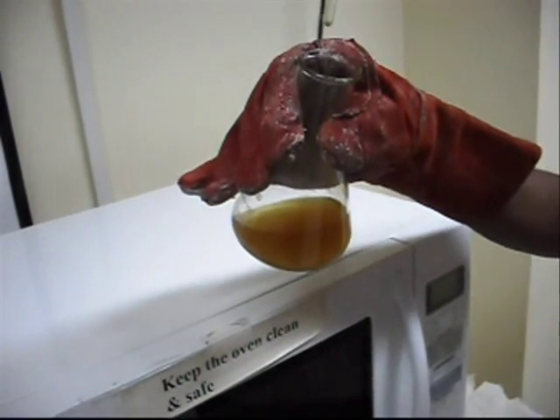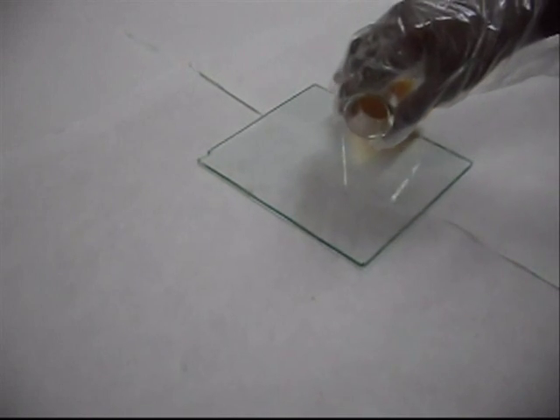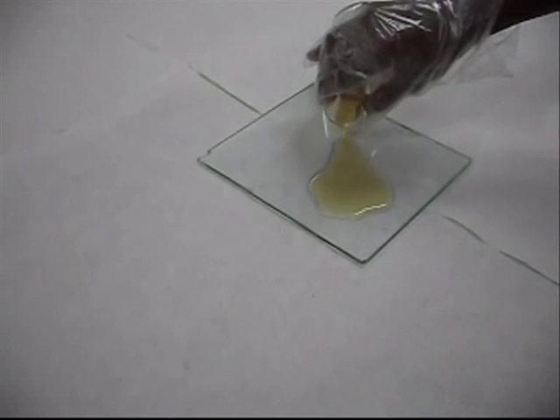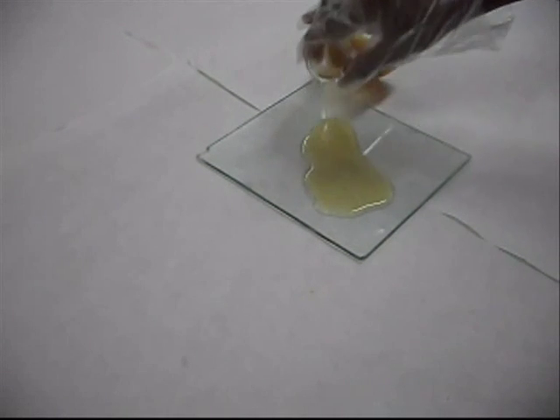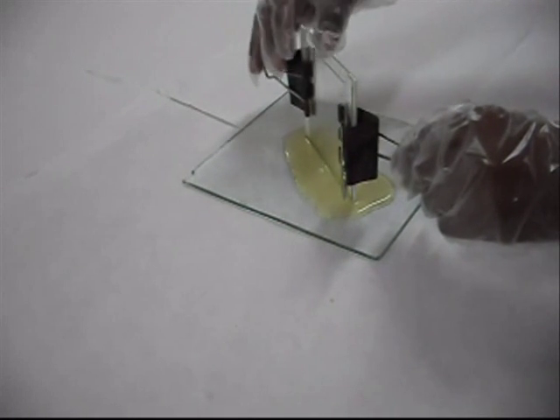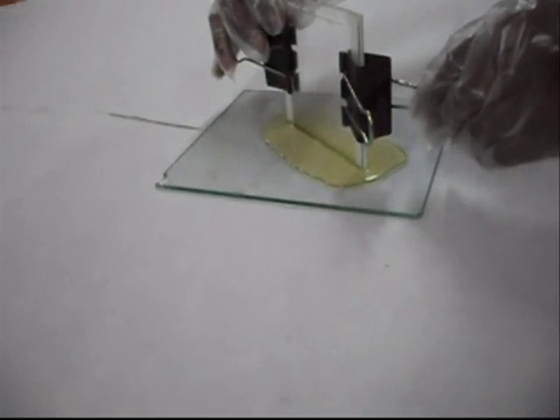After that, the agar is poured on the base plate. The plate assembly is placed in the base plate. Both sides of the plate assembly are sealed using the agar gel.